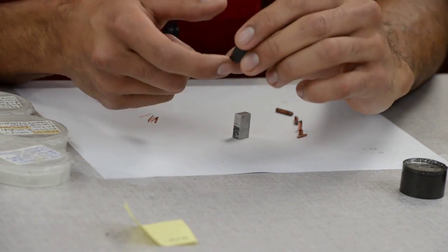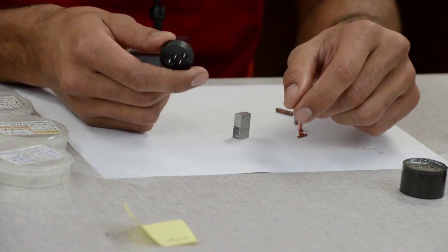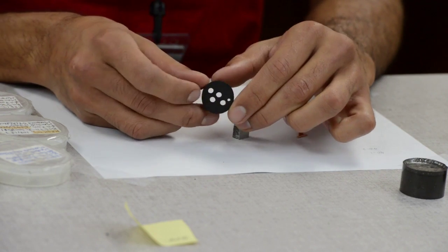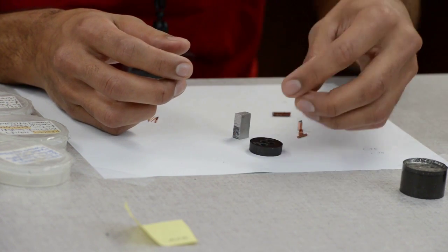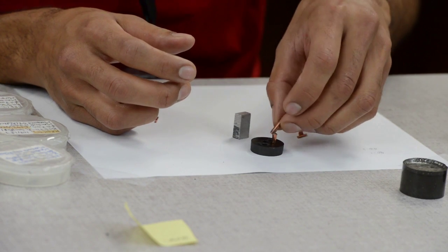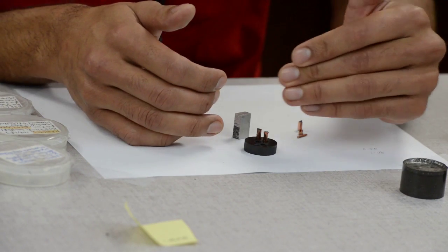And these wires can't stand on their own, so you need what is called a dummy puck. And what a dummy puck is, is just an empty piece of conductament to which I have drilled these holes so I can put my samples in there.